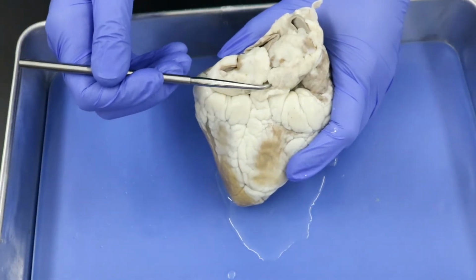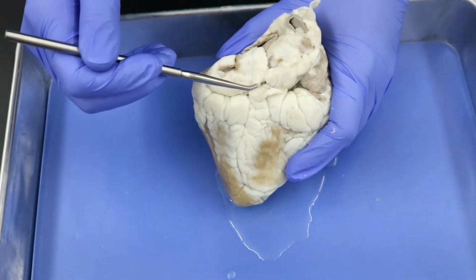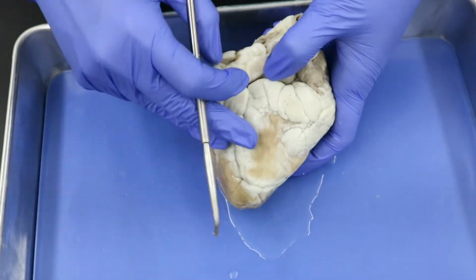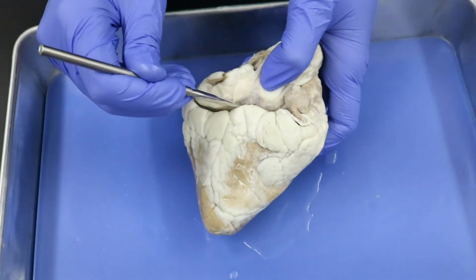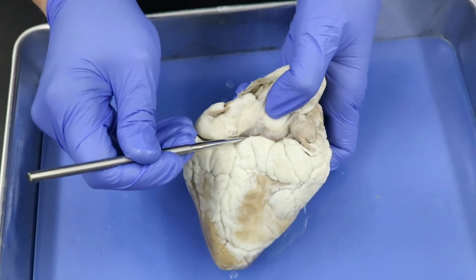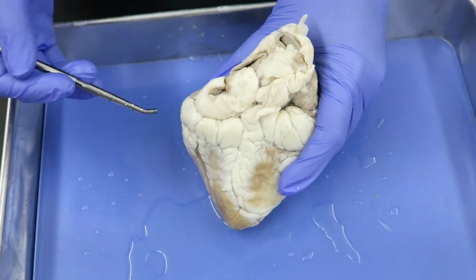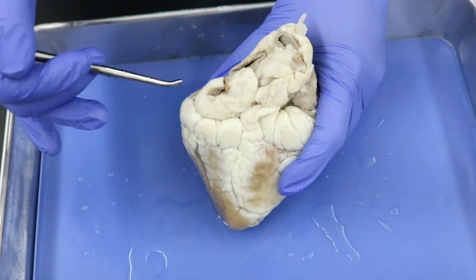So within our sulcus, kind of in the middle here, you're usually going to be able to find tissue of your coronary sinus, okay? So I have a lot of fat on this heart. I'm not sure how well we're going to see it, but right in this area is going to be your coronary sinus, all right? All right, last up, we're going to look at the pulmonary veins. So remember, veins return blood to the heart.